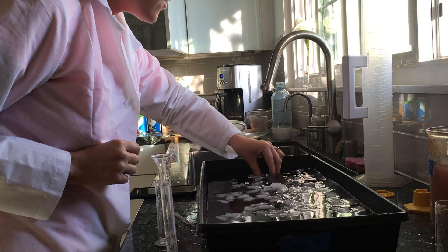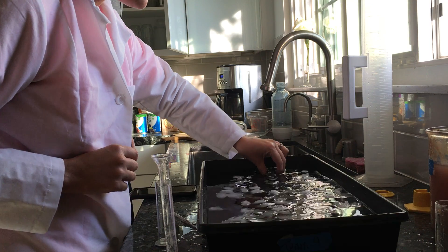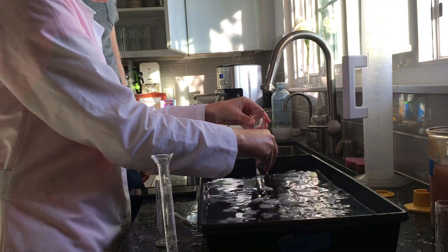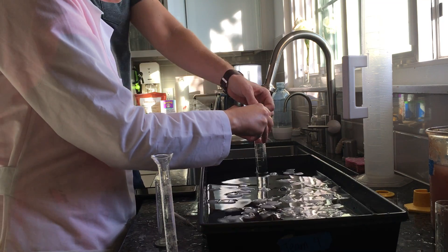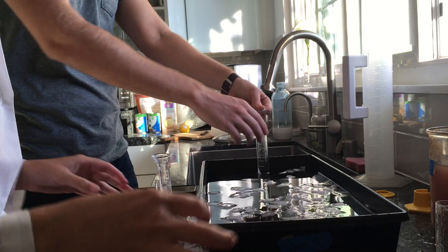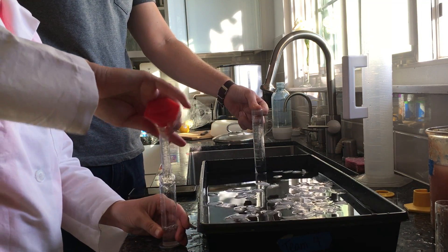Okay, so here I have now added a whole bunch of ice to the water and it's already starting to melt a little bit, which is great. So the water is nice and cold. We've got our 10 milliliters of hydrogen peroxide.